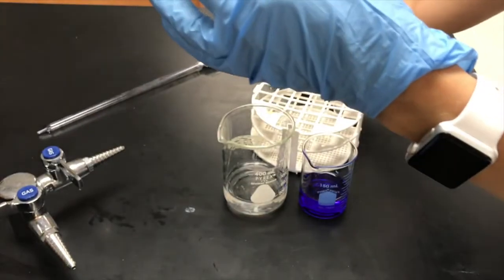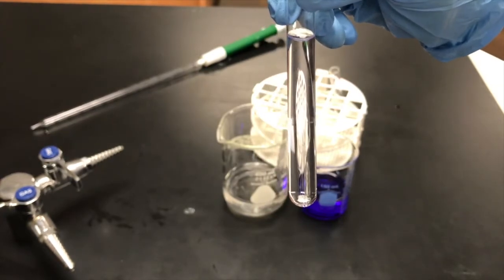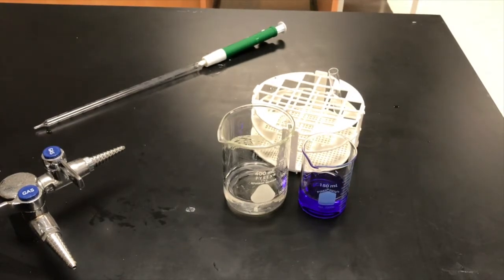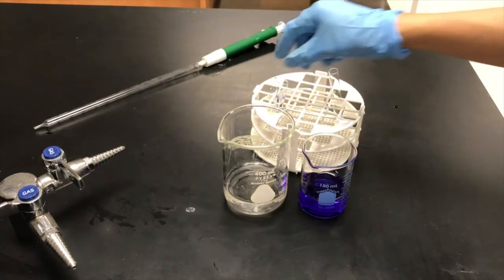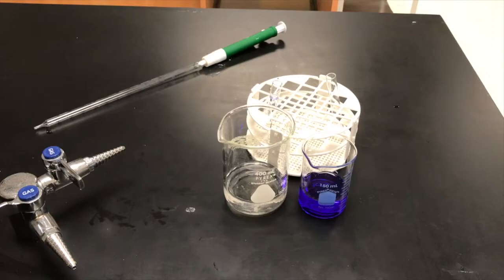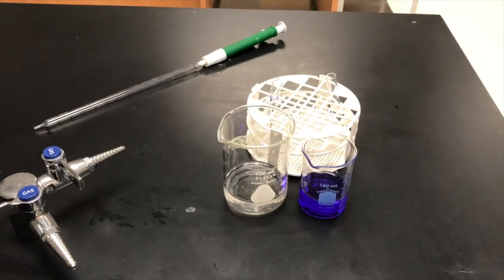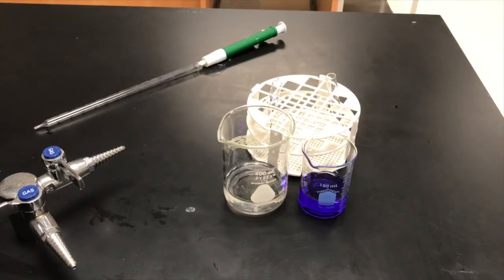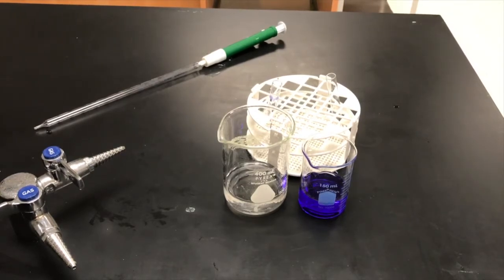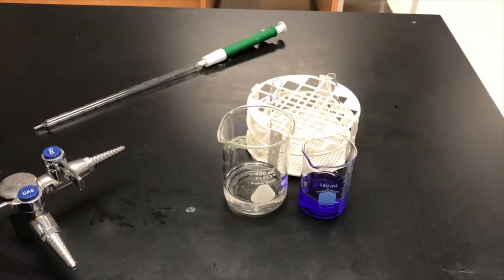I've disposed of the excess in the sink and created one solution at the correct concentration. You now need to create four other solutions: one at 5 micromolar, one at 7.5, one at 10, and one at 12.5 micromolar. Once you have all the solutions, take them to the spectrophotometer, zero it with pure water, put each cuvette in, and measure the absorbance of each solution. Then plot concentration on the x-axis and absorbance on the y-axis to create your Beer's Law curve.